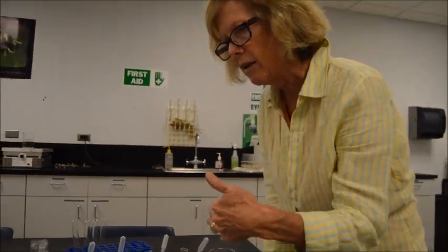Hopper just mentioned that vegetables and trees and fruits and all kinds of plant material have to store their carbon and energy somehow. So the question is, how do they do it? And you see from this test, potatoes store their carbon and energy as starch.